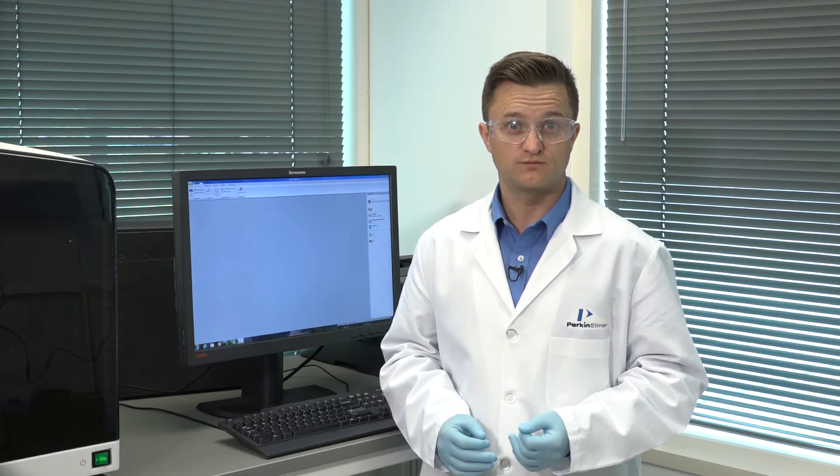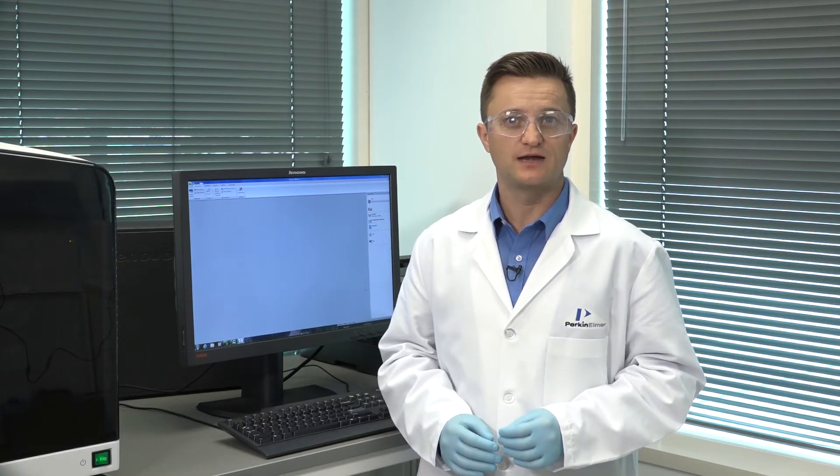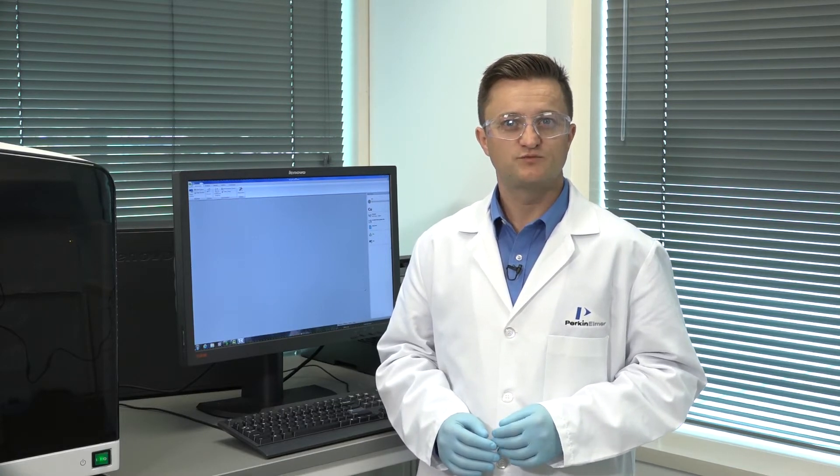I'm Aaron Heineman and in this video I will demonstrate the automated way to align the burner head both vertically and horizontally with the PerkinElmer Pinnacle 900 AA, which makes it an amazingly simple procedure.